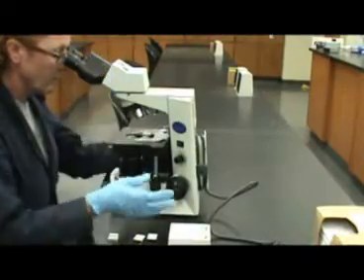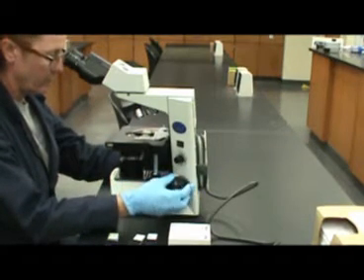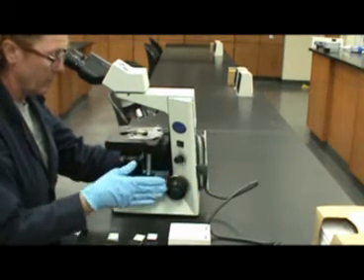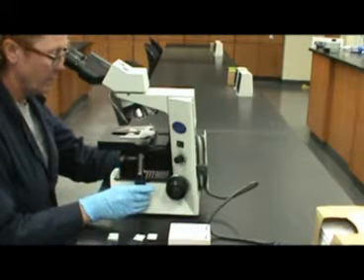You are now ready to begin focusing the microscope. Position your slide so light is shining through the center of the slide containing your specimen.